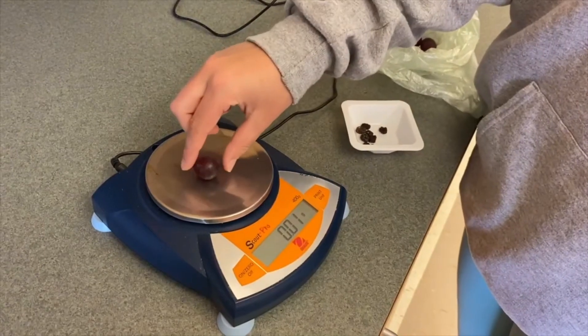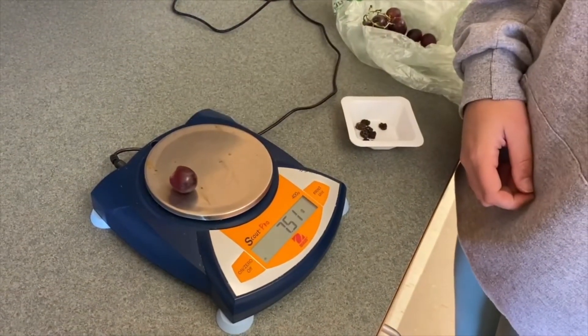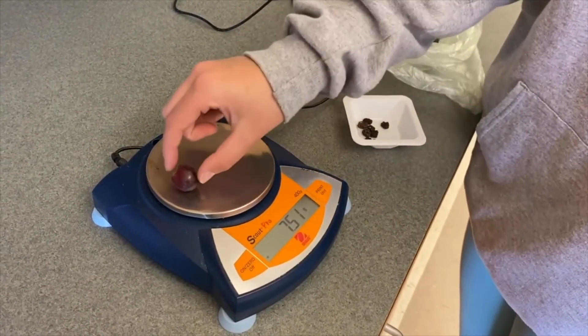Weigh each grape and raisin. Be sure to record the weight of each grape and raisin in your lab packet.